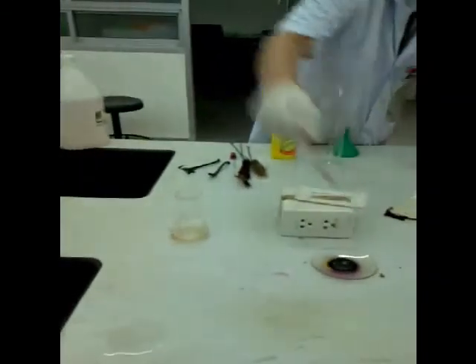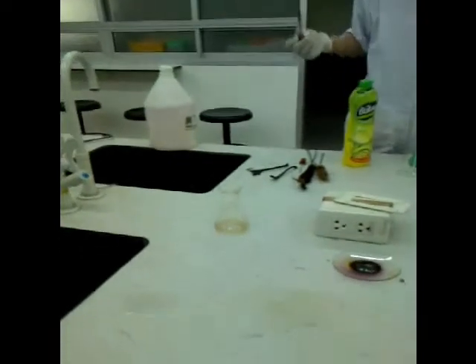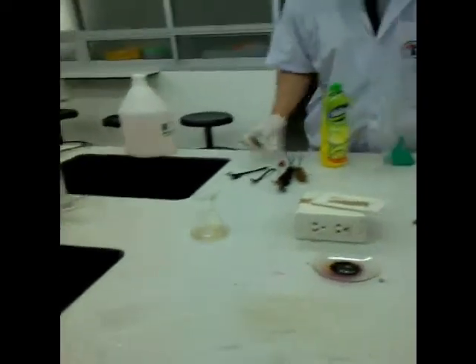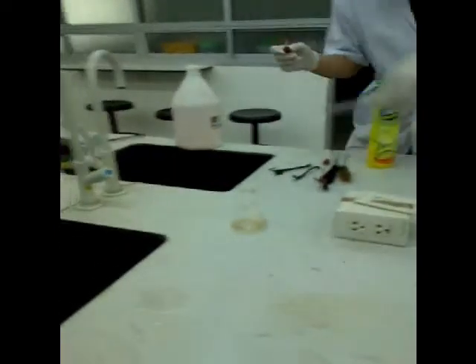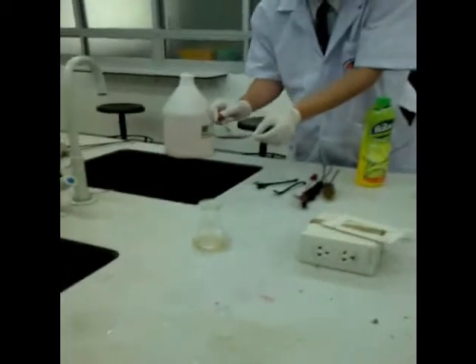This is dangerous now. Don't try this. Oh my god. What happened? Oh shit. Wow. Wow. Wow. Wow.